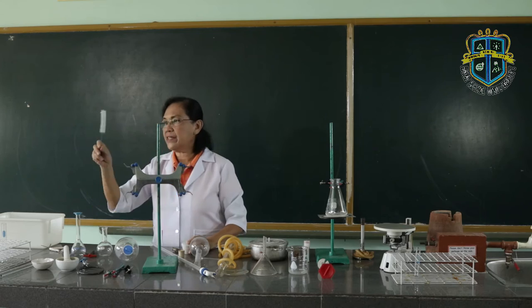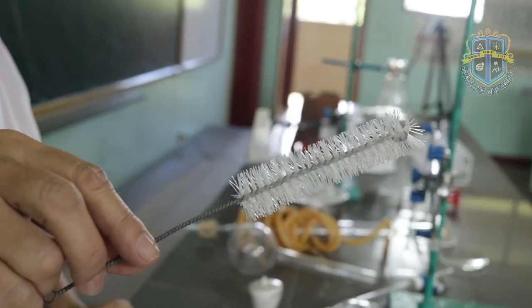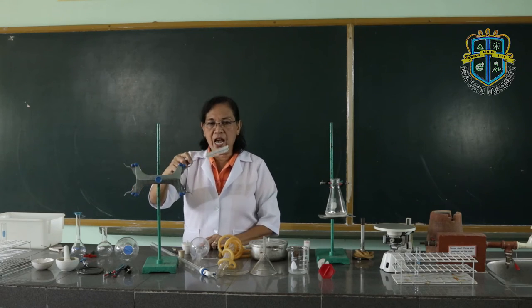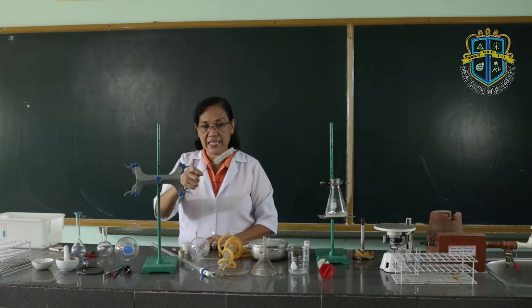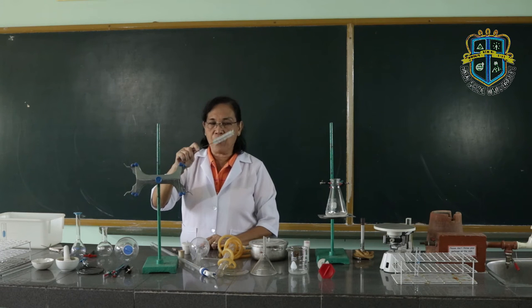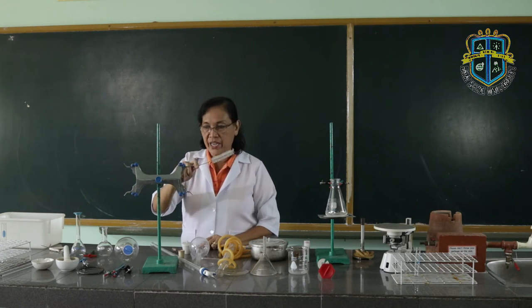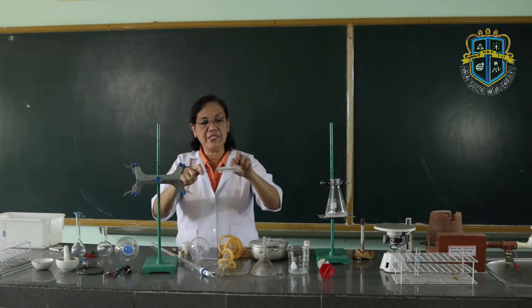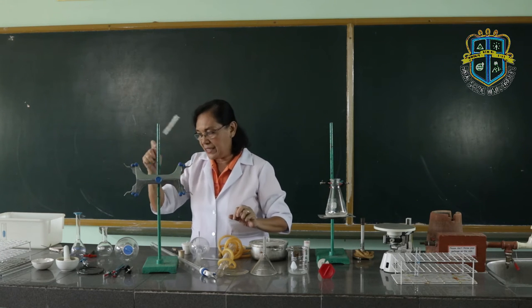This is the test tube brush. It is used to clean the test tubes. When you use the test tube brush, do not use it when cleaning test tubes that contained acid. It is only used to clean test tubes with detergent and water — not acid — because the bristles will melt once they come in contact with acid.